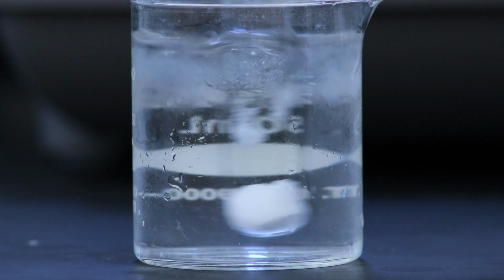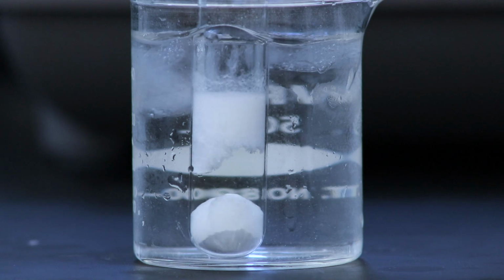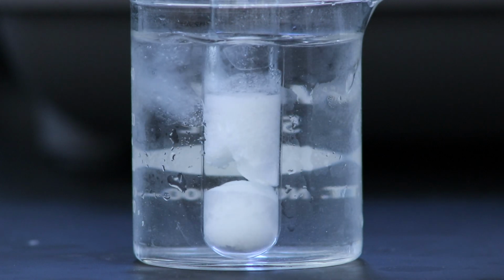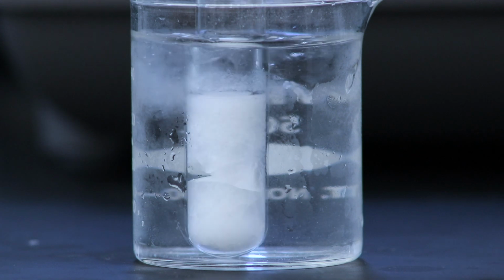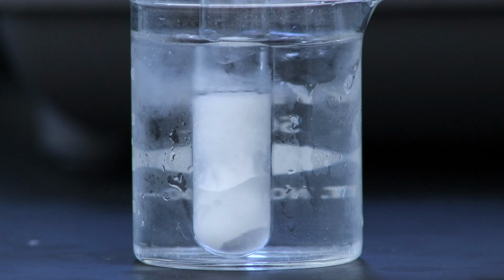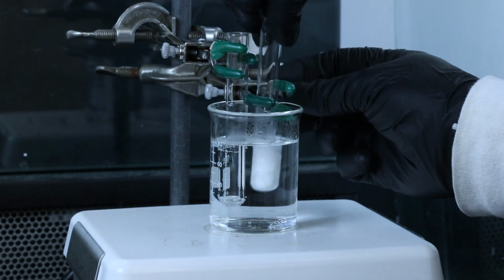Now I've sped the end of this video up a bit, but it took about 2 minutes for the product to fully come out of solution, and if I hadn't stirred it in the ice bath, it's possible that it would have recrystallized slow enough, but I want to try leaving it out at room temperature to see if I can get an even slower recrystallization. To let it recrystallize at room temperature, you want to redissolve the solid so you can take it out of the ice bath and put it back into the hot water bath.